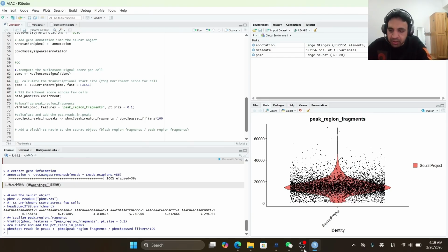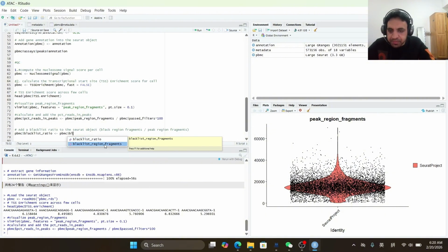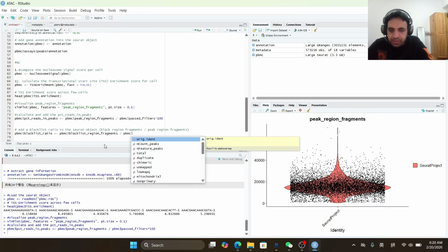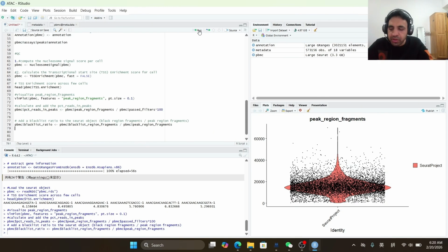So now we will add a blacklist ratio. So PBMC, add blacklist ratio. As it is the ratio between blacklist region fragments and peak region fragments, we will access these two metrics one by one. So blacklist region fragments and PBMC, and now we will access the peak region fragments and run. The blacklist ratio has been added to the Seurat object.